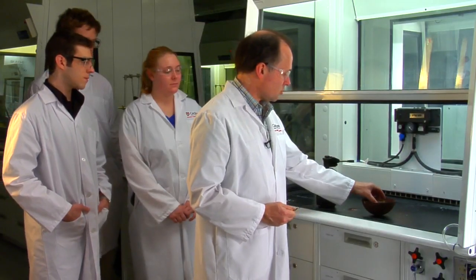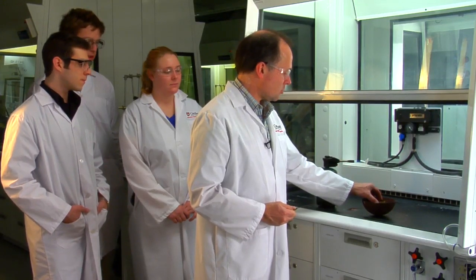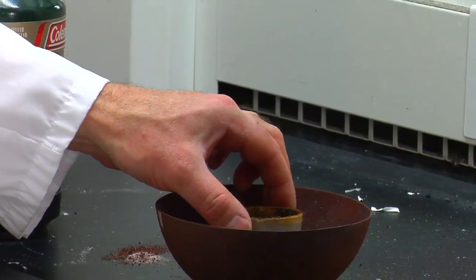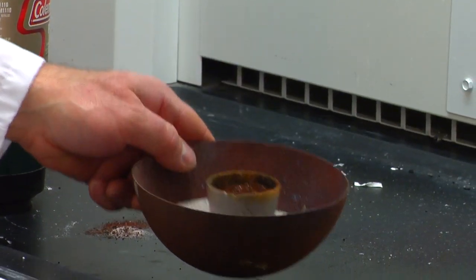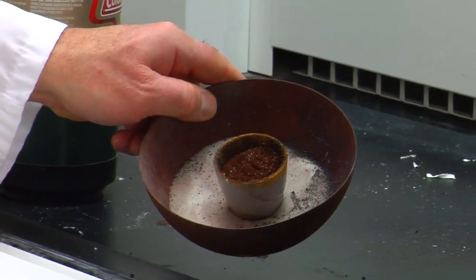What I have in this crucible is a mixture of iron oxide, which is rust, and aluminum metal.